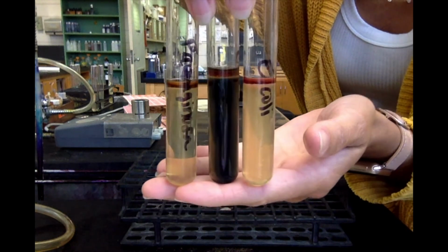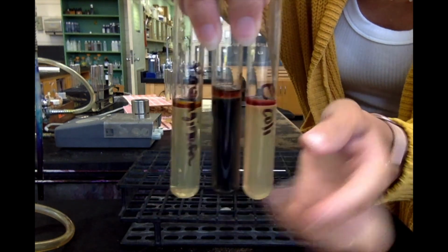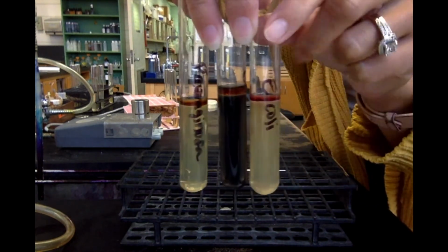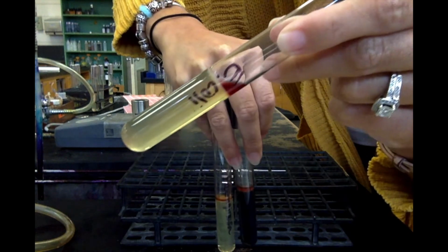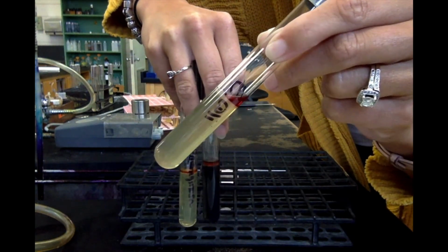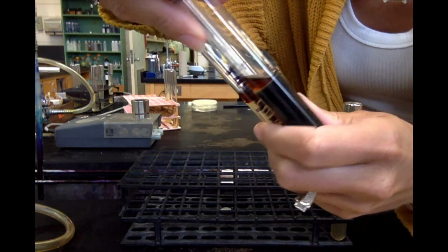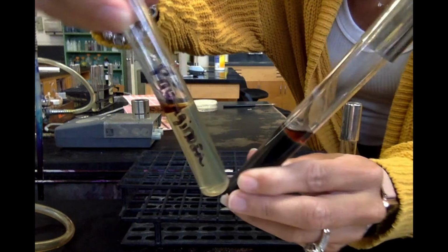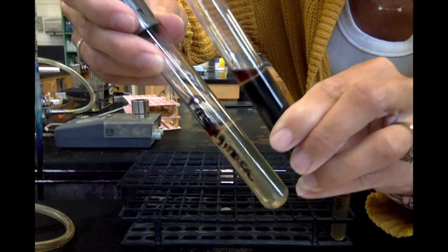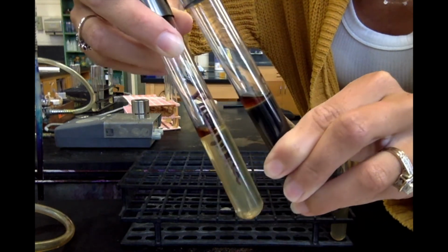So if you look and see, remember, red is positive. Our E. coli is the only one out of these 3 that gave me that bright red color. A lot of times I like to turn it sideways so that you can see the color of the reagent. So that's that nice bright red. Both Pseudomonas and Citrobacter freundii give me a kind of burnt orange, dark yellow looking color. And that is negative, okay?